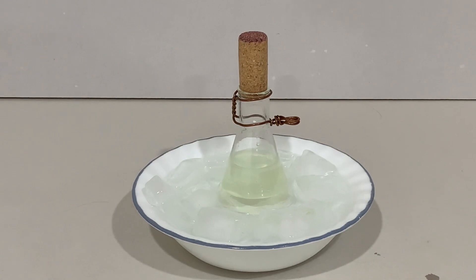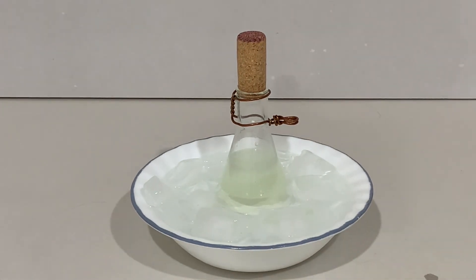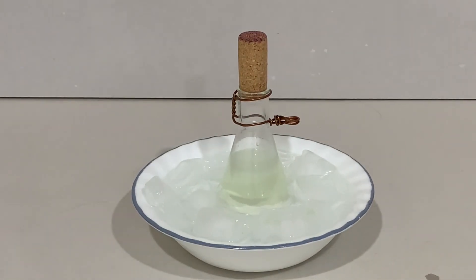Now this setup of bleach and acetone — notice how I didn't measure any bleach. That's because I didn't have much acetone. Is that going to be stoichiometrically correct in terms of bleach? Hell no, not close. I will leave this for an hour or two with the cork, while praying that that's all the safety precautions I need, and I will update you on the results.